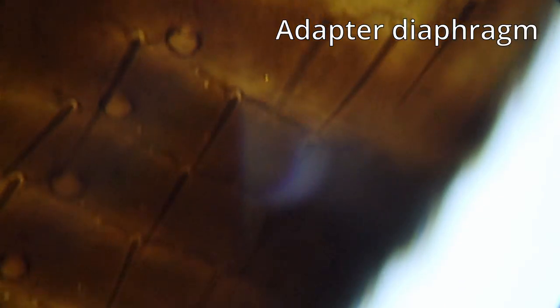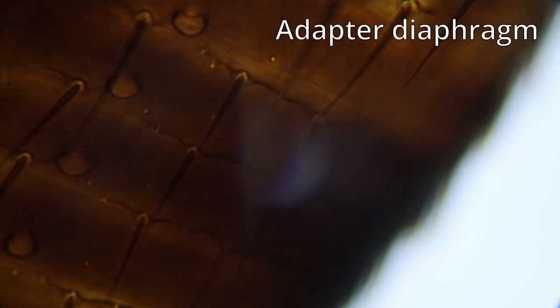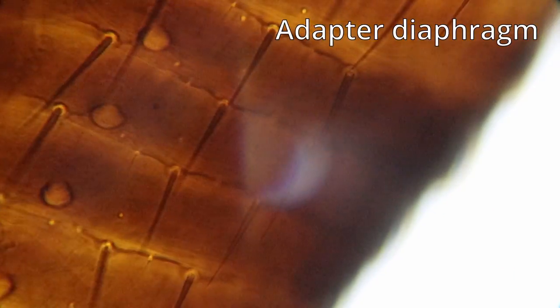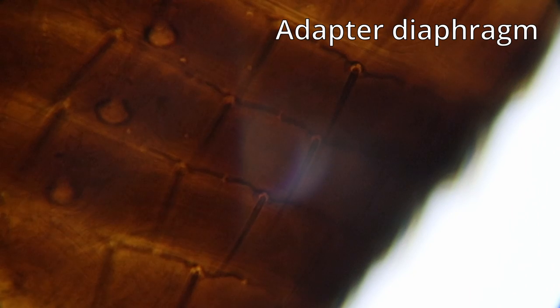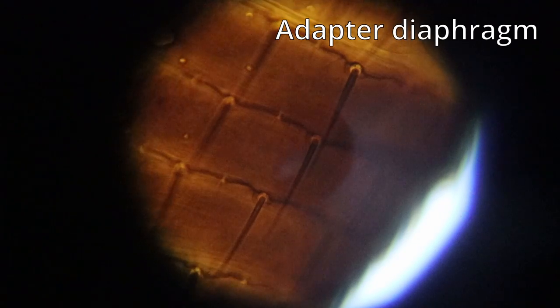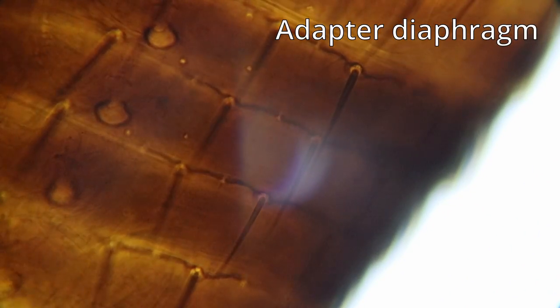And you see that there is this white spot in the center, and that's the glare that I was kind of hoping to reduce by closing the diaphragm, okay? Especially when the specimen is of high contrast like this, the flea over here, you can see quite a bit of glare in the center. Now, when I step it down, look what happens. The field of view goes down, okay? But actually not a lot happens with the glare. That's not the way it's supposed to be.